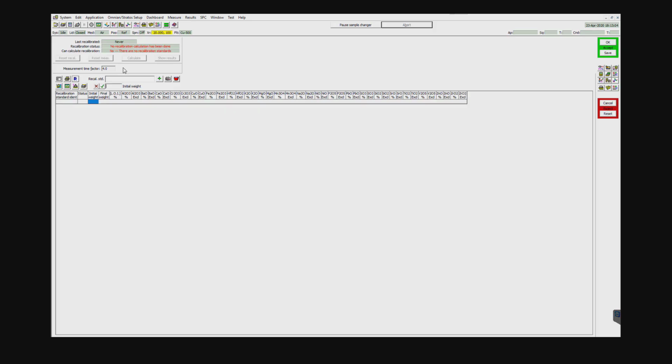Next, we need to consider for the recal samples something that's very stable, so something that's not a liquid or powder or something that's going to capture moisture and change the composition of the sample in that way. So if you can, store whatever stable sample you have in a desiccator. Secondly, if you want to correct for both D and E, you will need at least 2 samples, 2 or more samples. If you wish to just correct for E, which is slope, then you only utilize 1 sample here, okay? And everything, again, is based off of concentration in the Epsilon software.